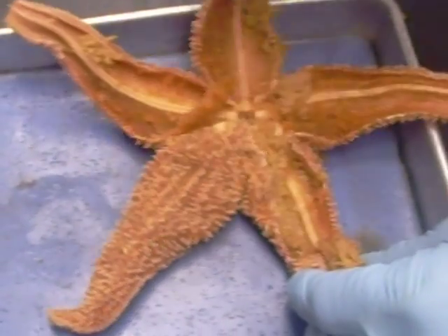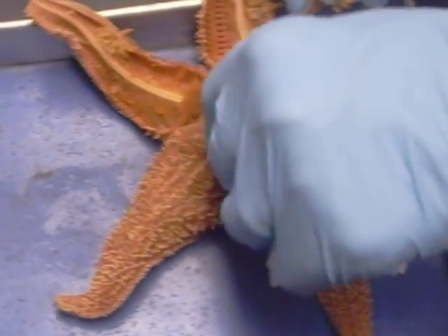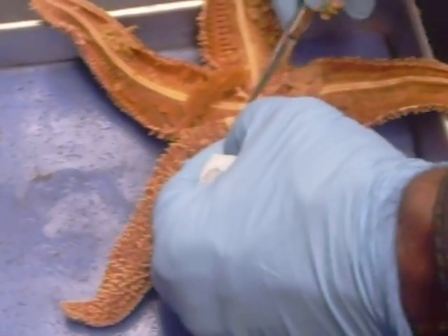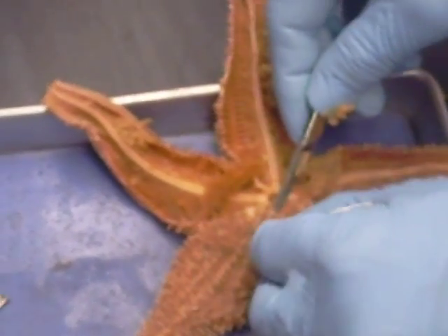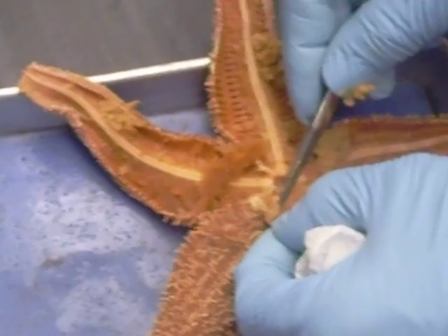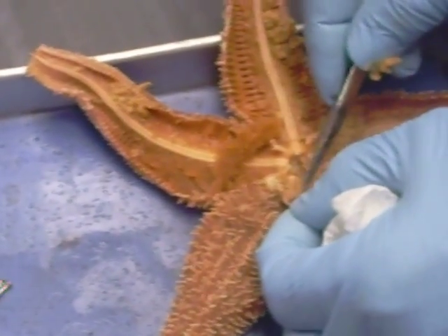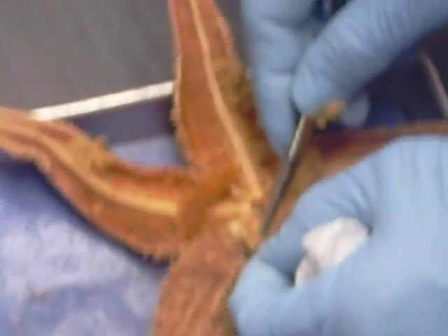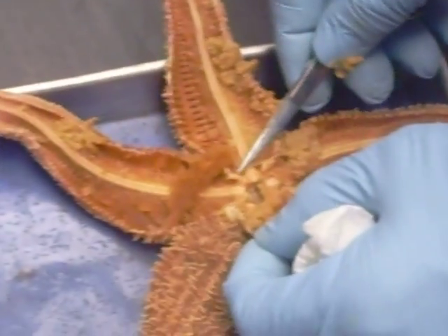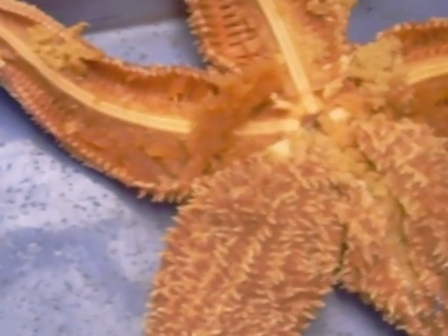What's the stomach? The stomach was removed. When this was first opened, this floppy little tissue in here was part of the stomach. It did have a cardiac and a pyloric portion to it, but I don't see it in this specimen.